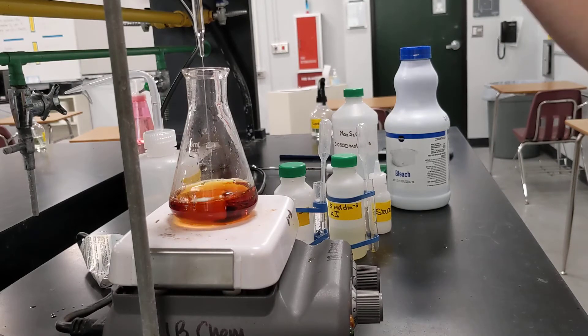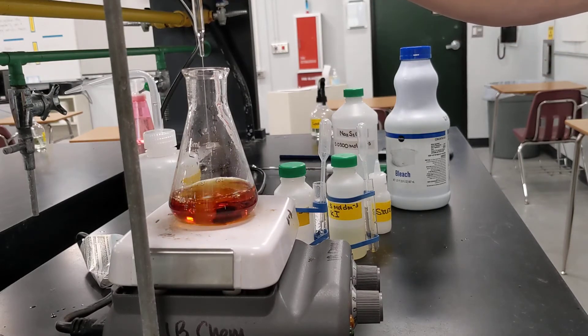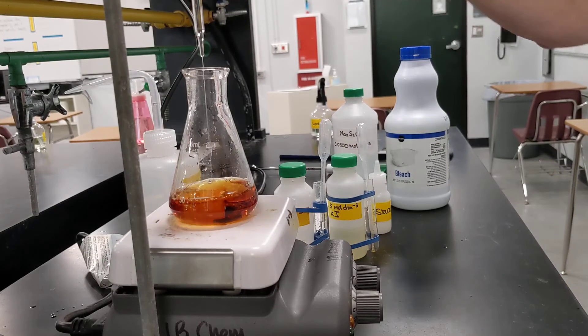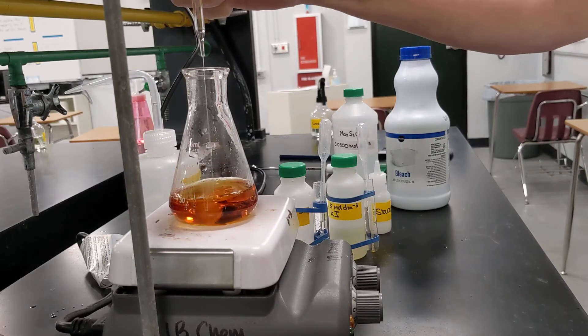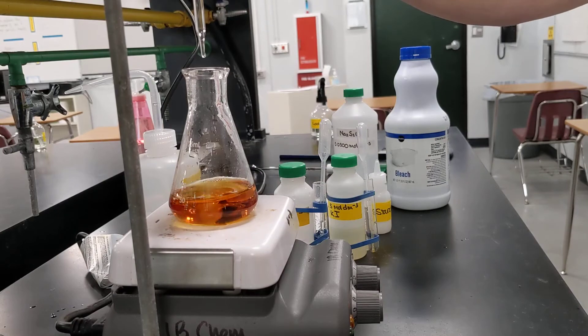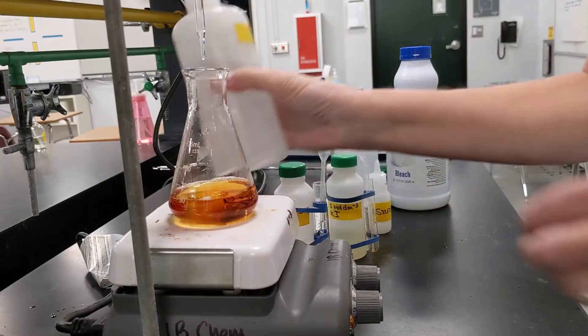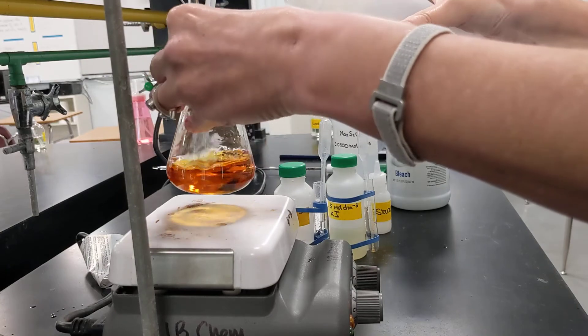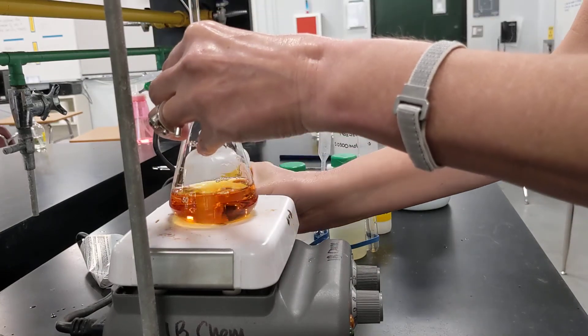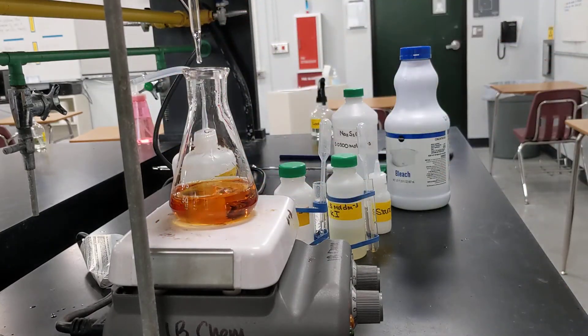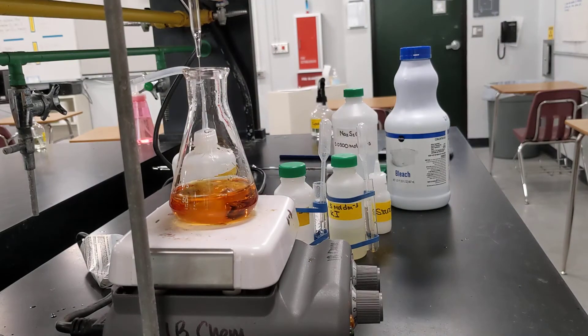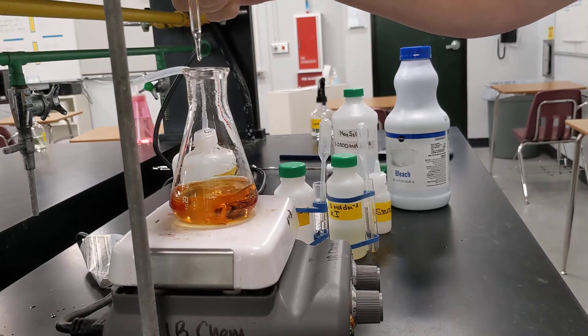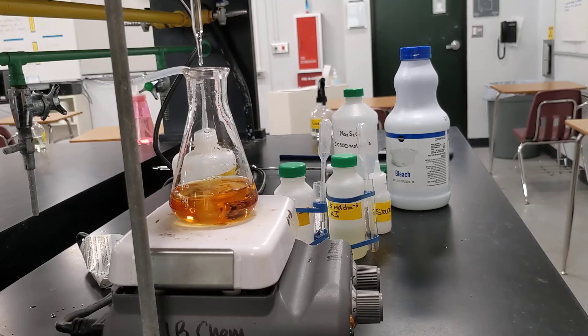So looking for yellow. And then at light yellow, I'm going to stop for a second. Let's slow this down a little bit. Let me just give a quick wash to everything in here. Make sure everything's down there. Okay, now a little bit more slowly, looking for that light yellow color.